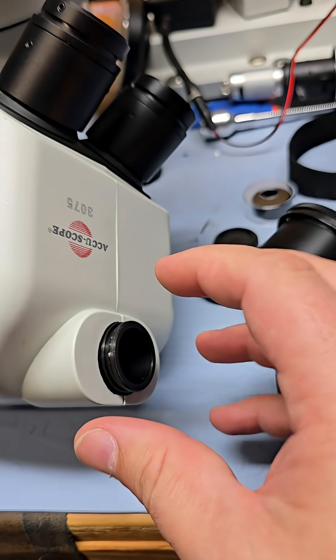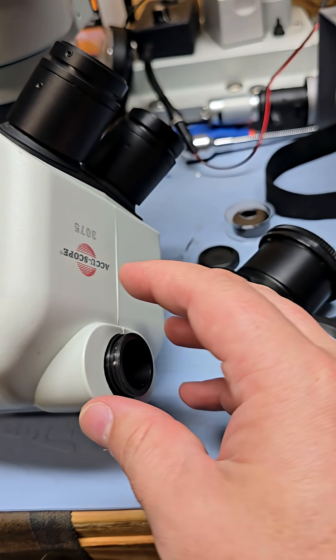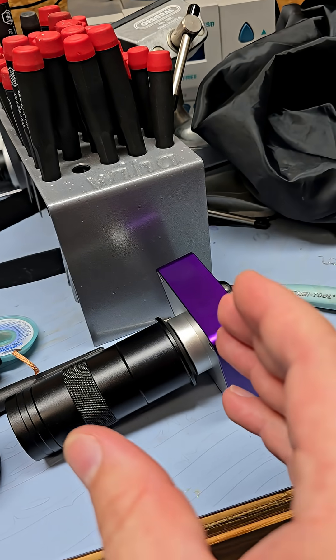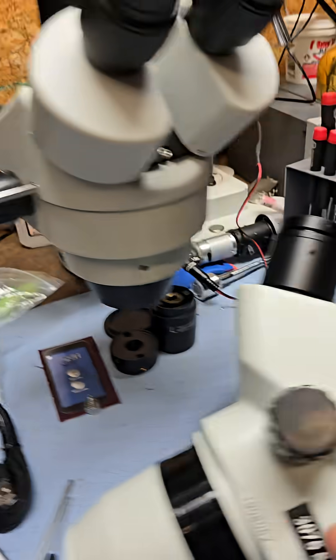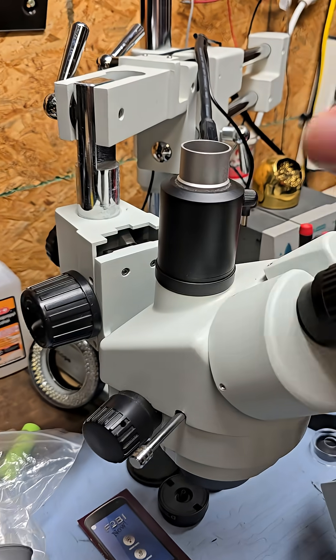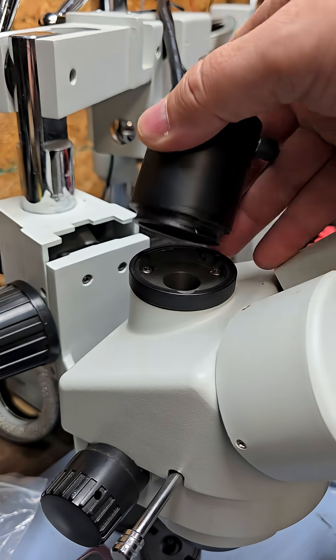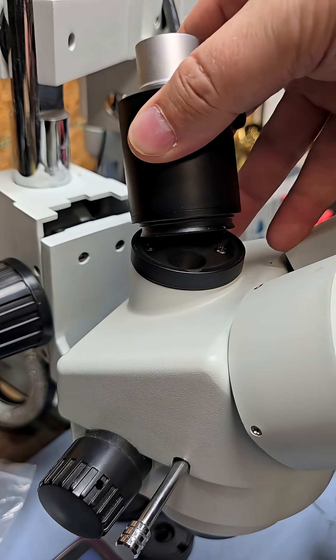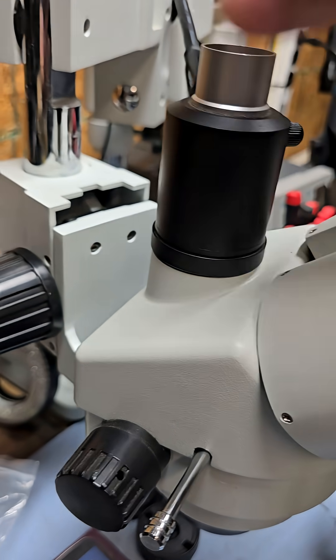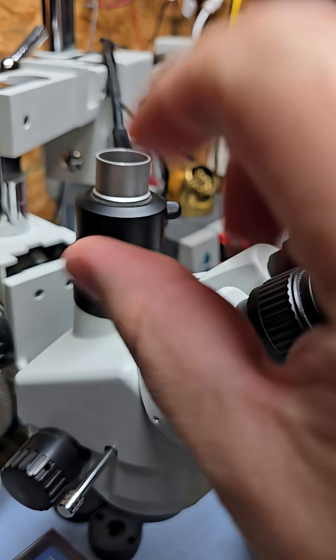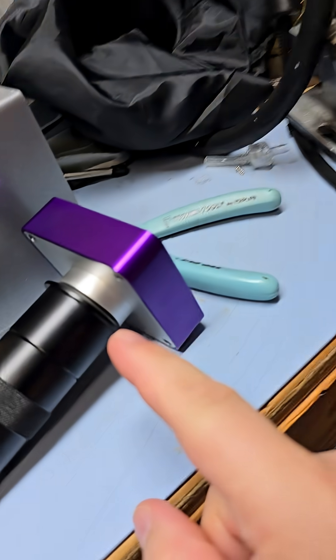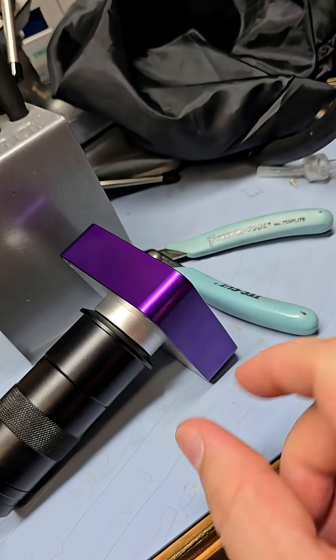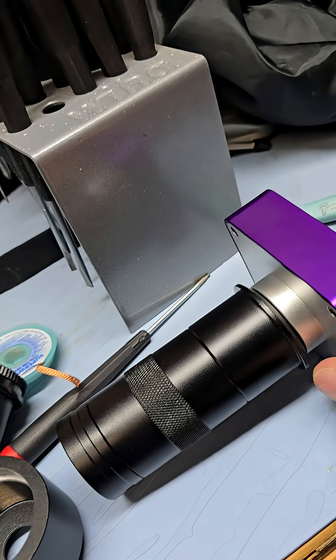So I would have to get an adapter from PhotoTube to C-mount. And on this one over here, I would need an adapter of AmScope to C-mount. And then I can mount my optic.